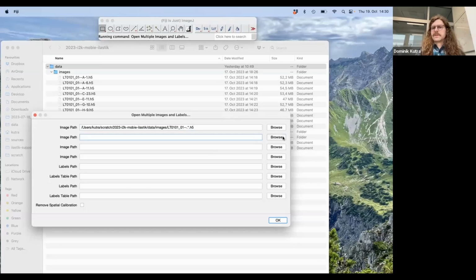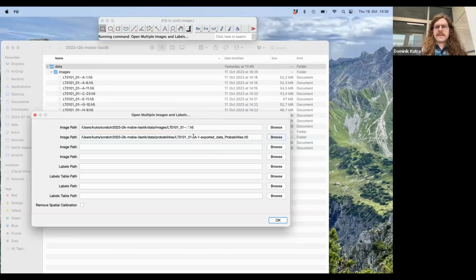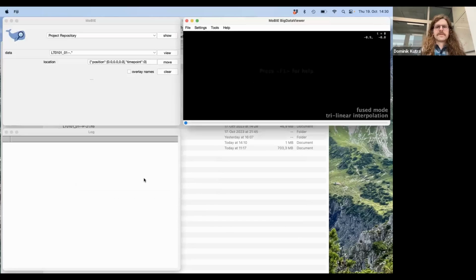Okay. So we do the same for the second type of input, which would be the probabilities. I also select the first one, and then I take the position identifier, or some ID that is changing between images, and I replace it by a dot star. And hopefully, if I press OK now, MoBIE opens.